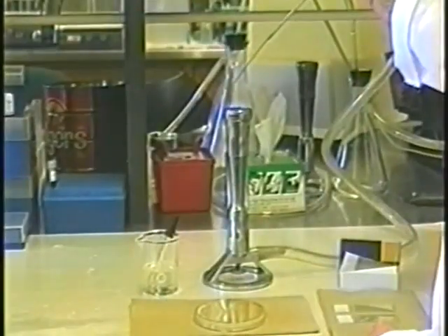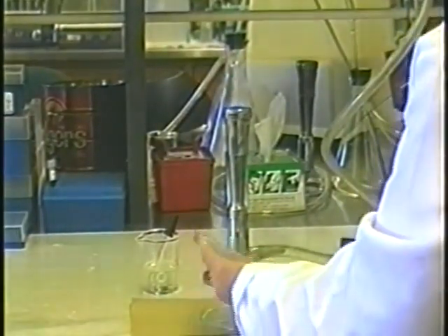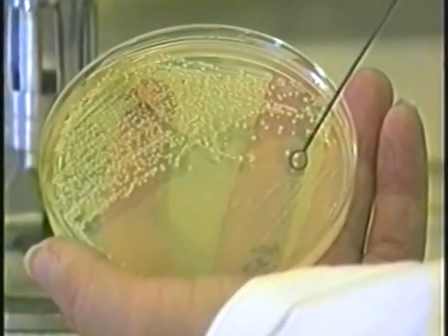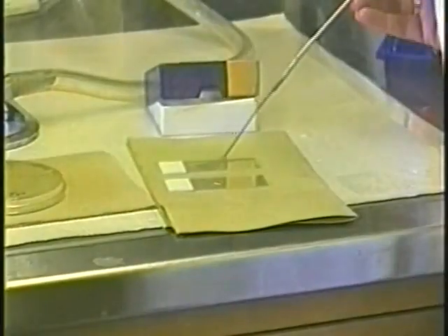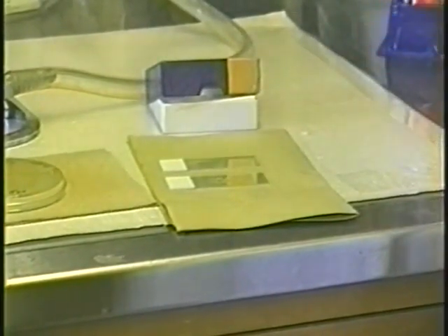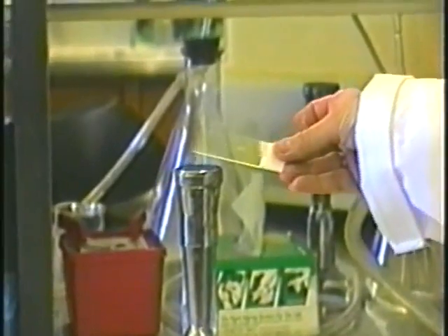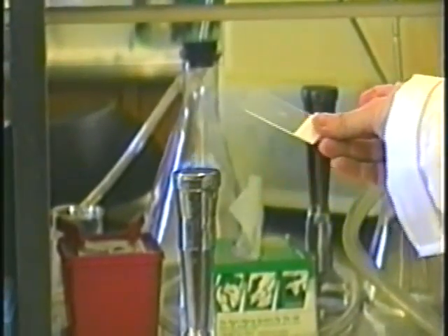To determine the gram staining characteristics for the bacteria you have isolated, flame a loop and carefully pick a portion of a single bacterial colony from the plate. Mix the bacteria in a drop of water on a clean slide. Allow the smear to air dry and heat fix it by passing it over a flame. A gram stain may also be done directly on a smear from a lesion.